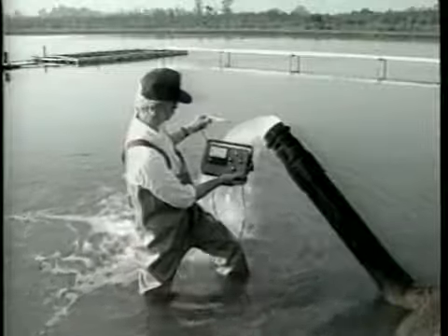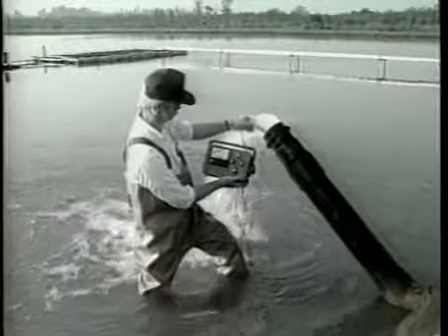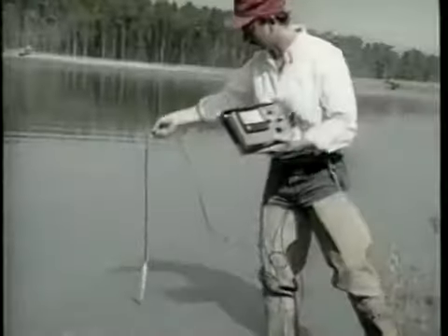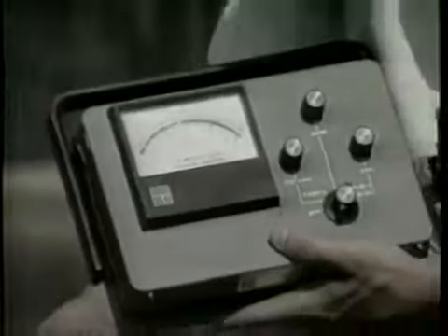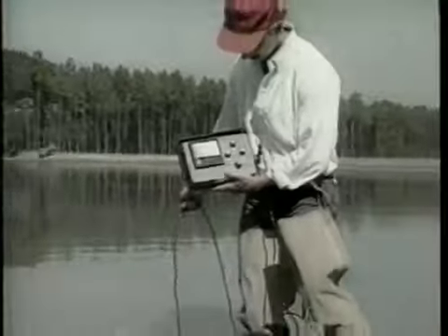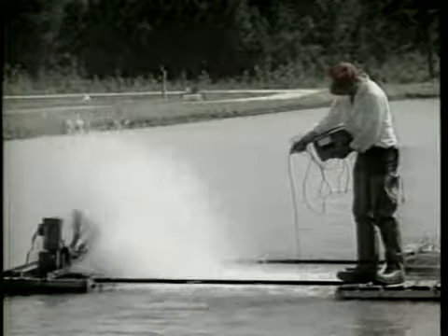If the oxygen reading is made near incoming well water, as shown here, the value will be low since well water is low in oxygen. On the other hand, if oxygen is measured in dense algae bloom, the reading will be abnormally high during the day and abnormally low at night. Oxygen will also be higher near aeration devices.